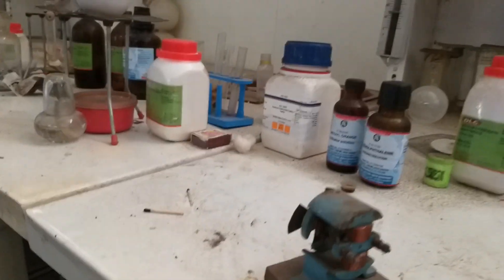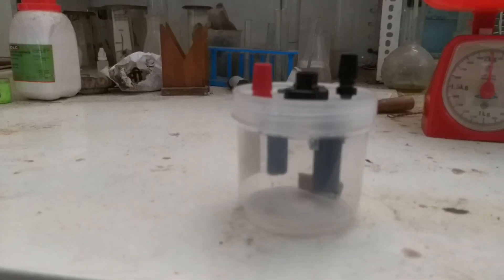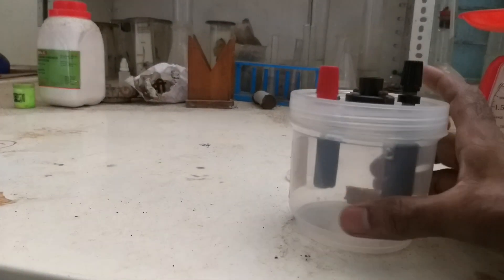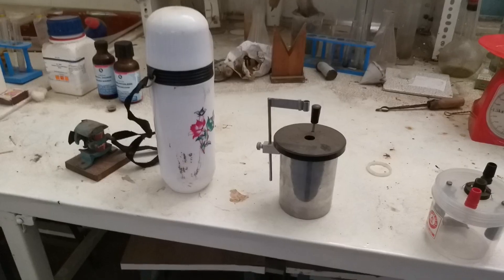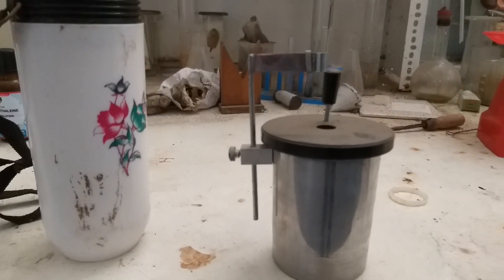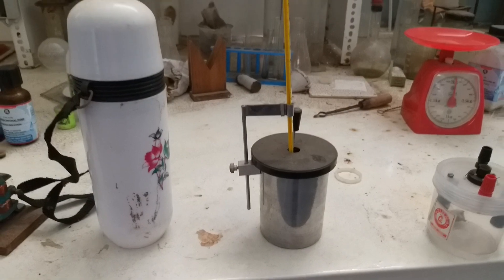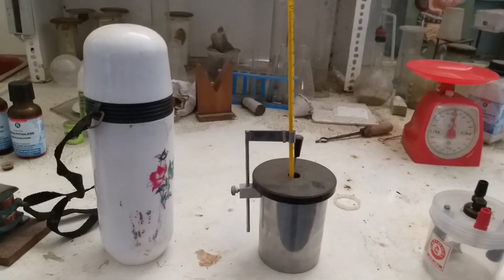These are some chemicals required for electrolysis with two electrodes, to check whether a substance is an electrolyte or non-electrolyte. We can use this apparatus with an electric bulb for that purpose.